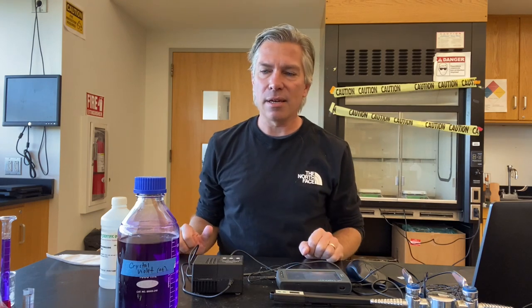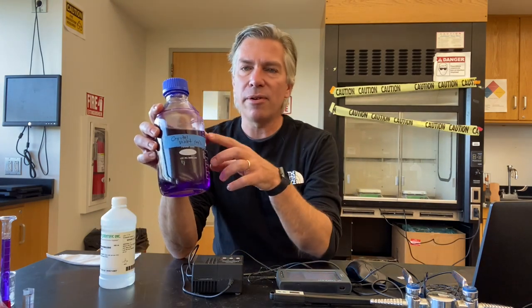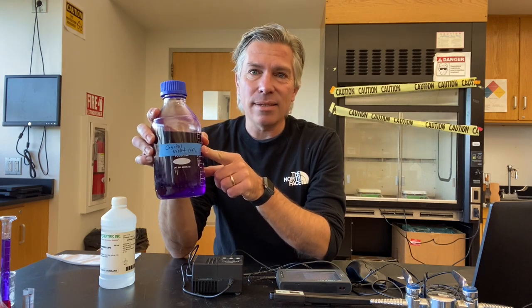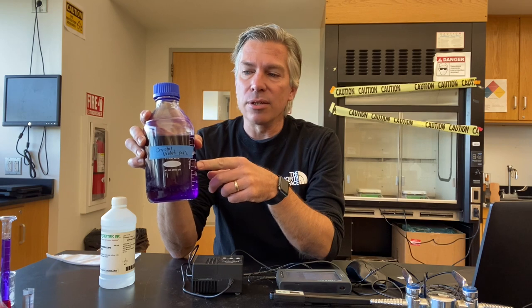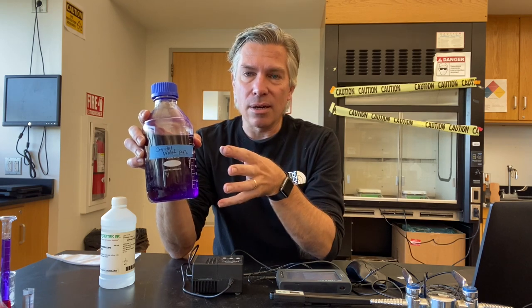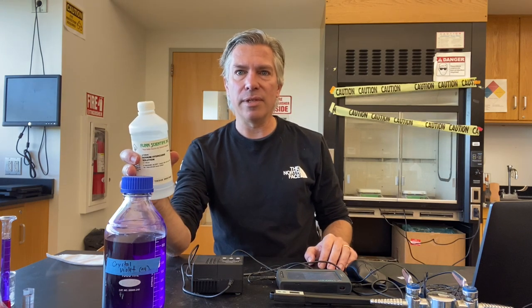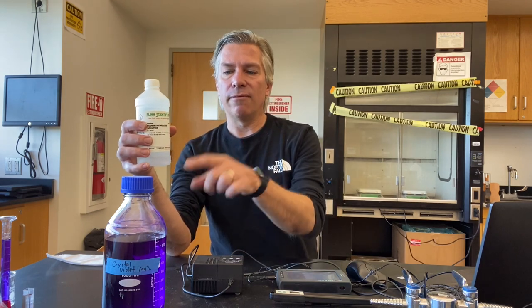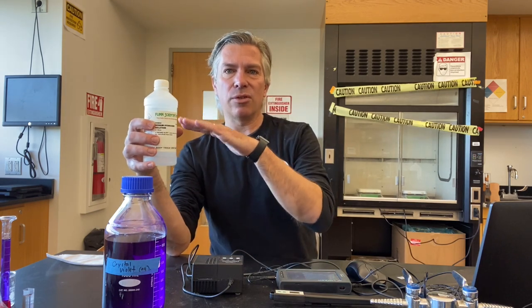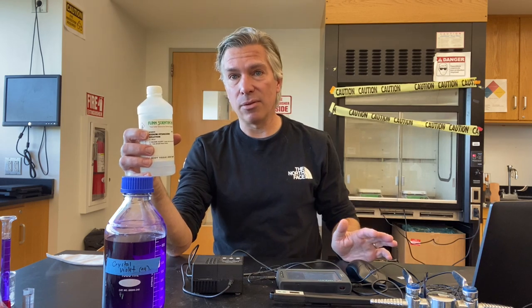Let's get a few business items out of the way. First, the concentration of my crystal violet solution is 2.5 times 10 to the minus fifth moles per liter. That's not a lot. There's not a lot of molecules in here, but you still get that really intense color. The concentration of my sodium hydroxide is 0.1 moles per liter, which is vastly higher than the concentration of this. So the concentration, because this is such a high concentration relative to this, this concentration is going to be essentially constant throughout the whole experiment.